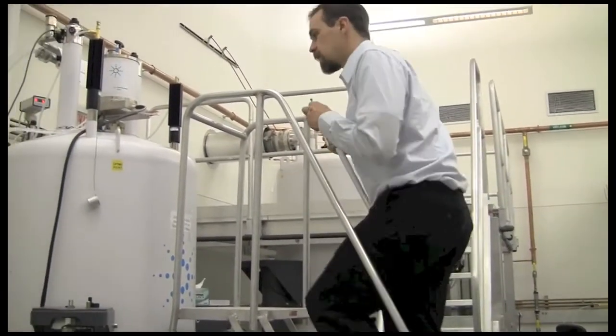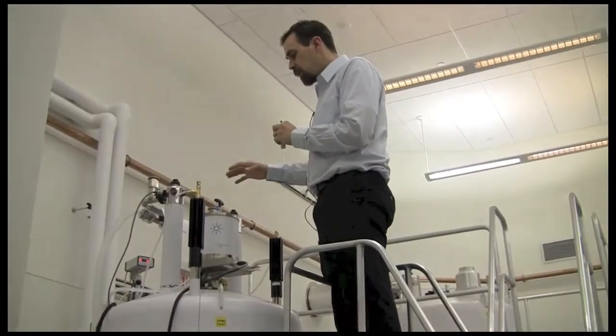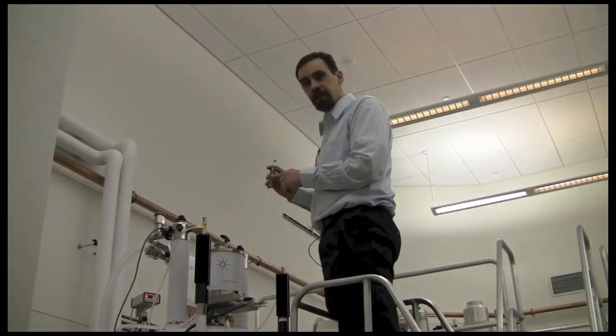Next, you're going to go up to the sample changer, and you're going to need to unlock the sample changer before you can put your sample into the sample changer.